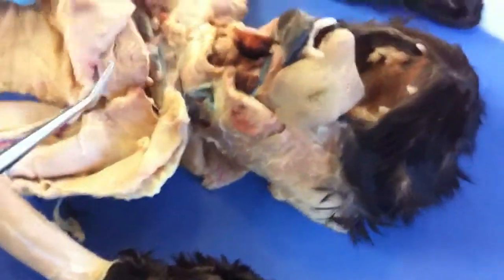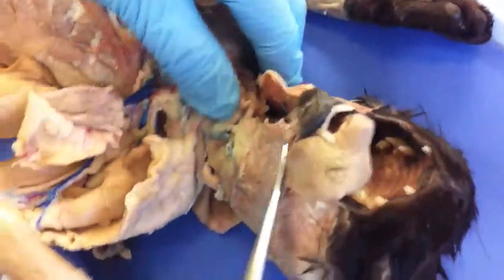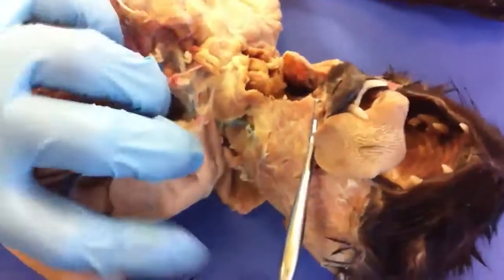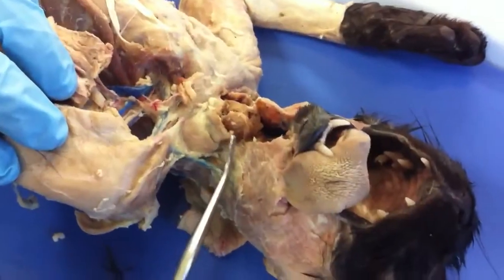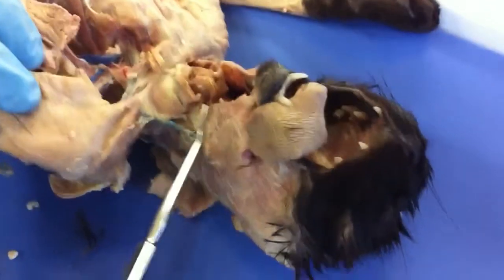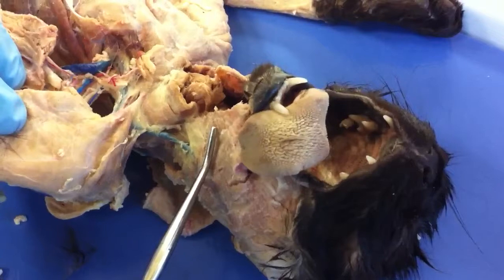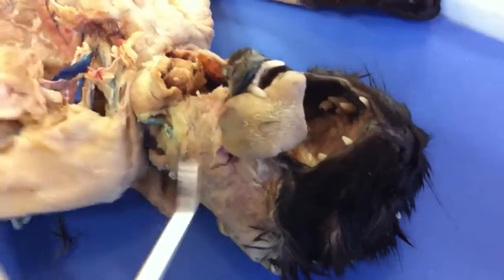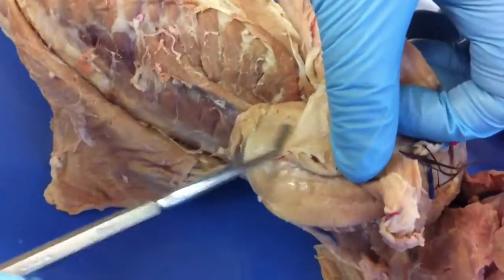The sternomastoid is the strong, paired neck muscle — it originates at the sternum and goes all the way up to the mastoid process of the neck. The subscapularis is the one on the subscapular part.